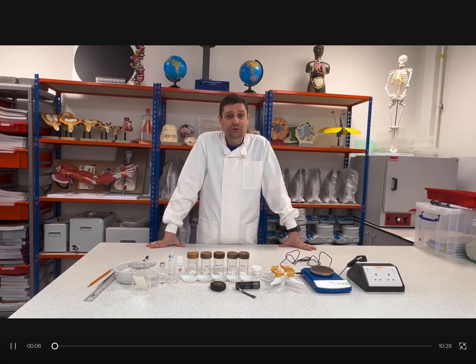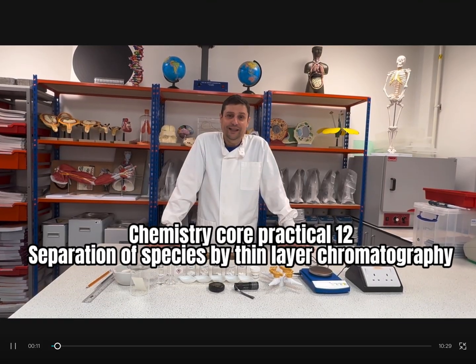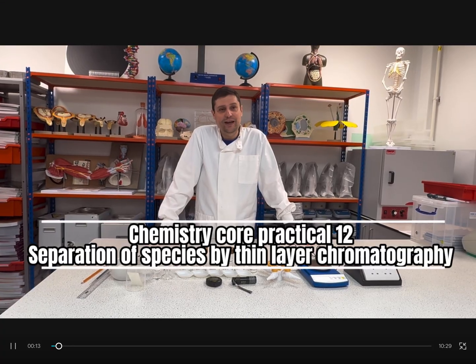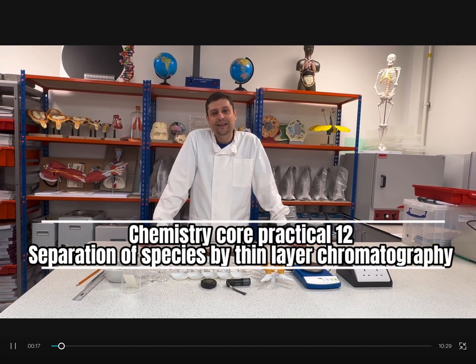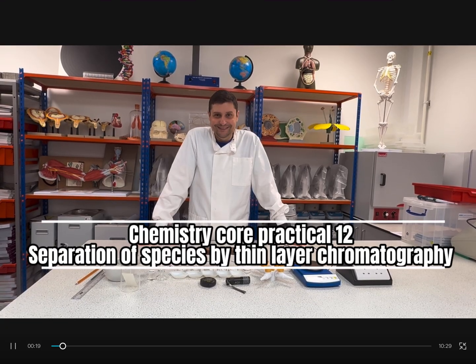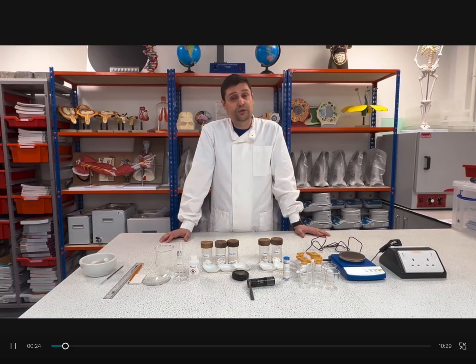Today I will show you the chemistry practical for A-level number 12, separation of species by thin layer chromatography. So for the method, the first thing we will do is grind the sample.